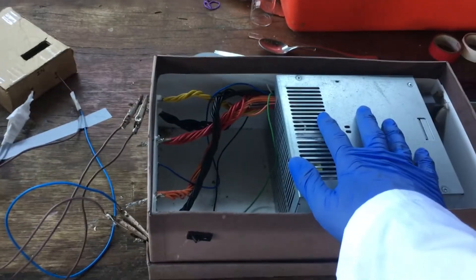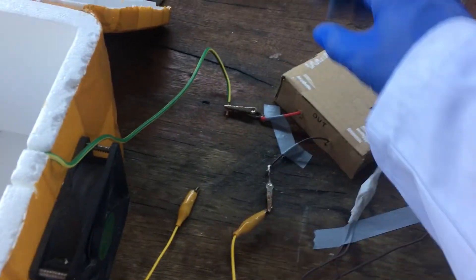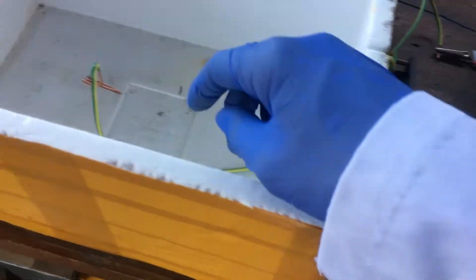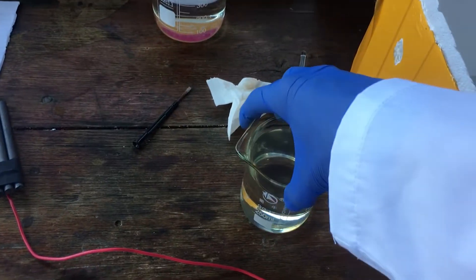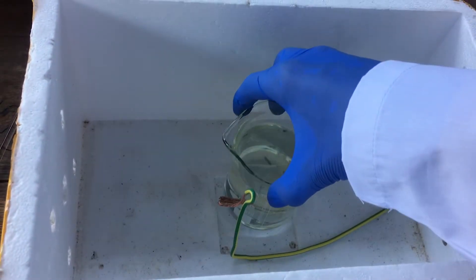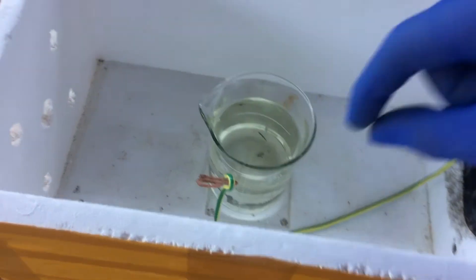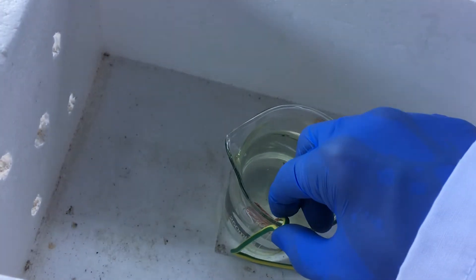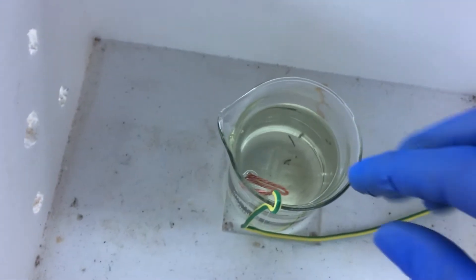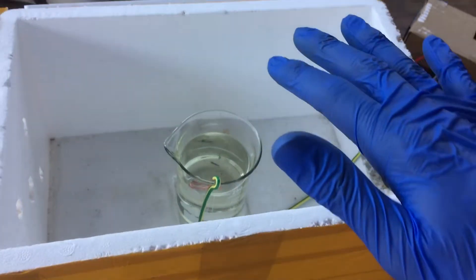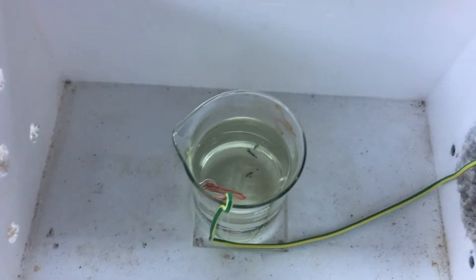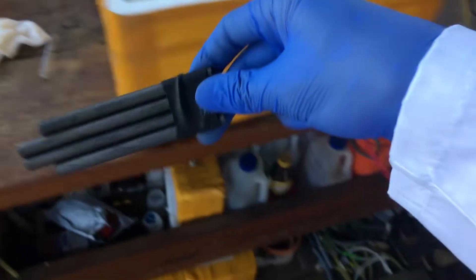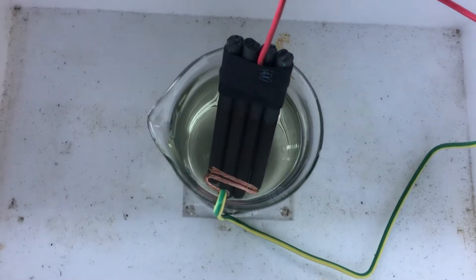Now that I've set up the power, we've got our PC power supply, 12 volts going into our buck converter, and then currently it's set to 2 volts, which is coming out. I've got the cathode ready here, and all of the sodium bromide and sodium bisulfate have finished dissolving. So, we'll put our solution into our electrolysis chamber to contain any spills, and we'll stick in the cathode. We want to try our best to keep the cathode as close to the surface as possible, because the bromine's going to sink to the bottom. We don't want the cathode to reduce the bromine back into bromide ions. And then, as soon as we put in our anode and connect it up to the power supply, we should start generating bromine.